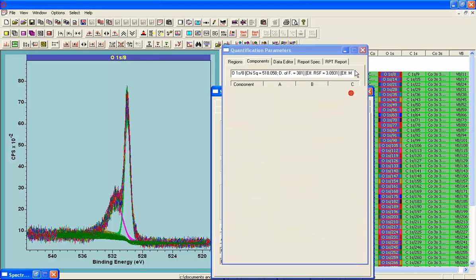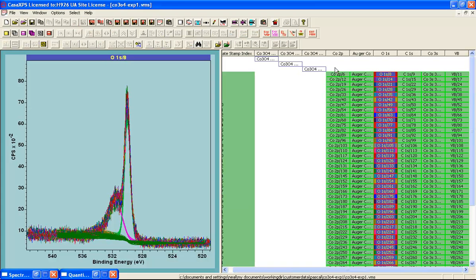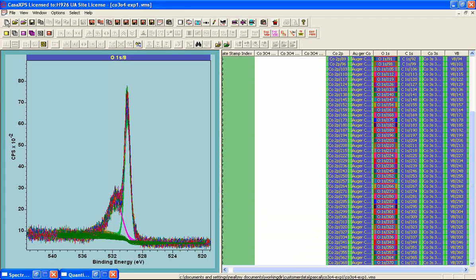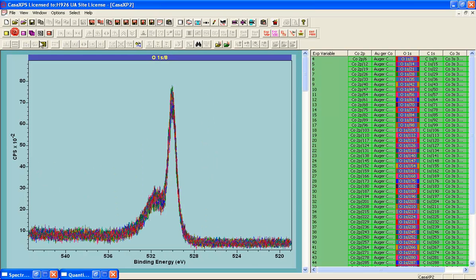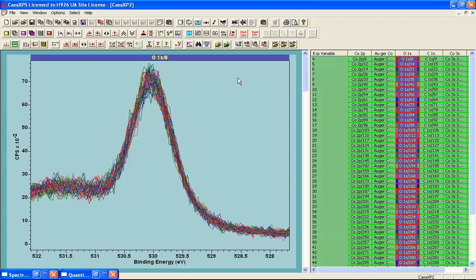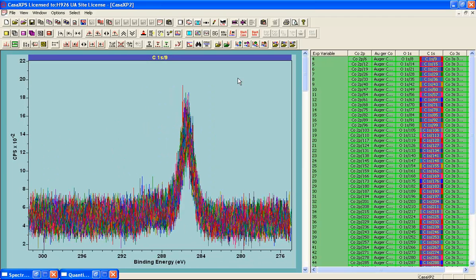If we wish to sum these data, we need to perform a number of operations, and one of these will be to copy the set of spectra into a new file and copy these data using the option to copy process data only. So now all the calibration processing has been preserved. So when I overlay the data from the oxygen, you can see that the peaks are aligned, and the same alignment will be part of each one of these spectra that represent carbon or the cobalt 3s.